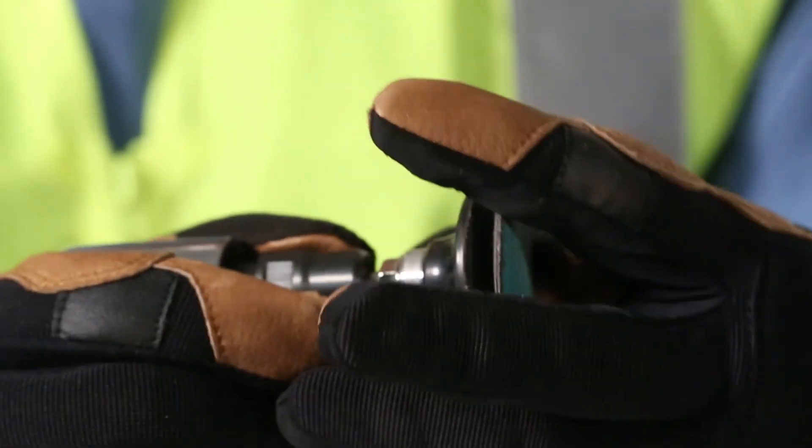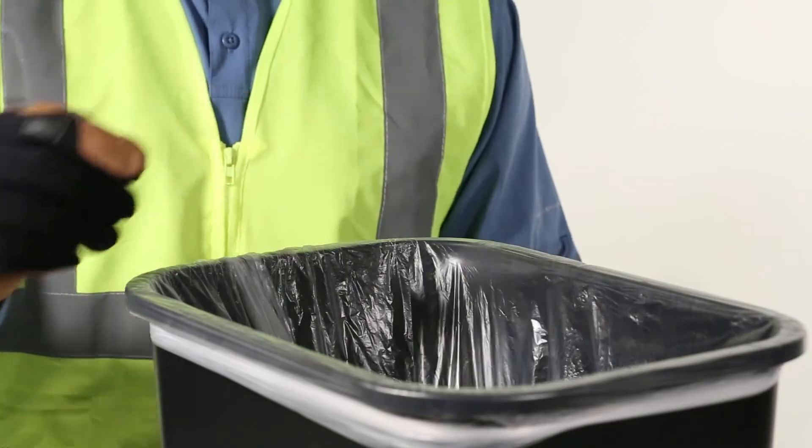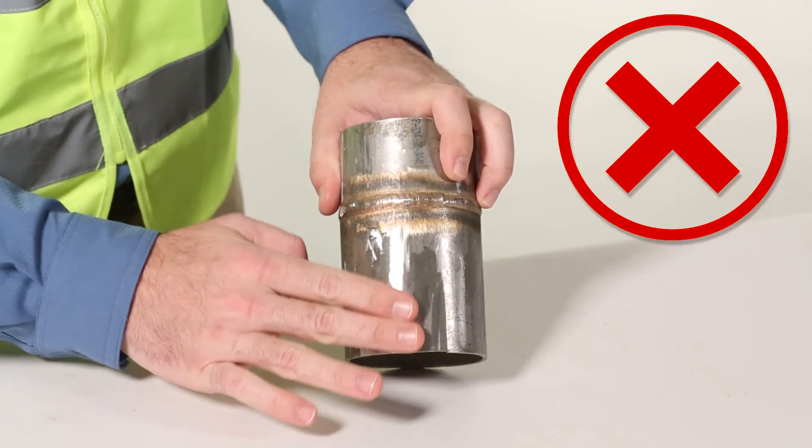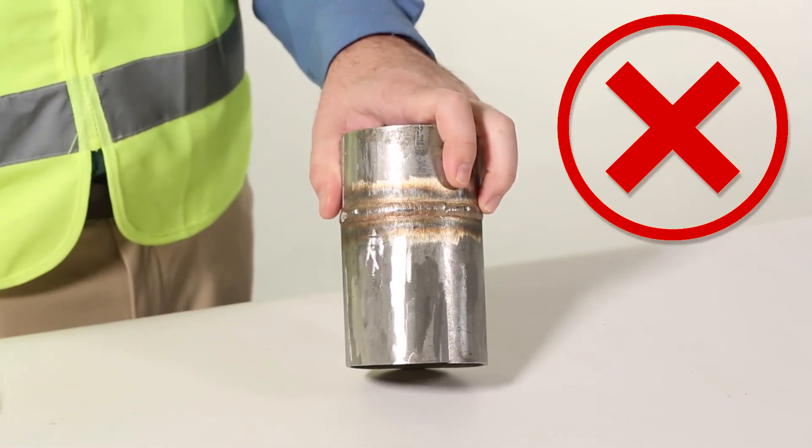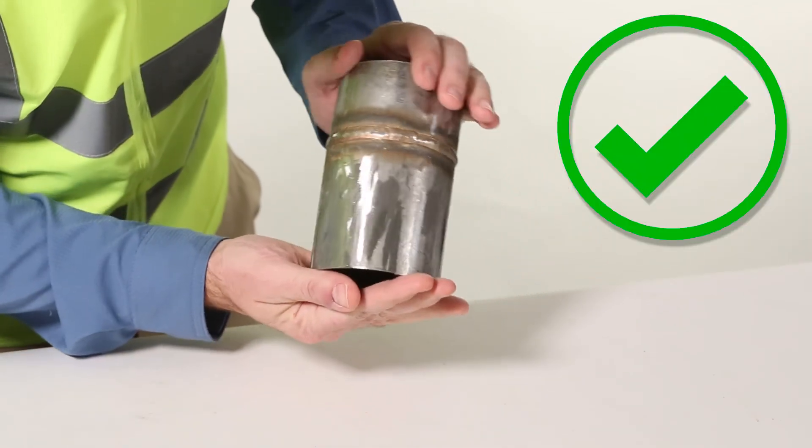Once grinding is complete, remove and discard the sanding discs. Avoid touching the area. Instead, handle the sample from the sides as oils from the skin can contaminate results.